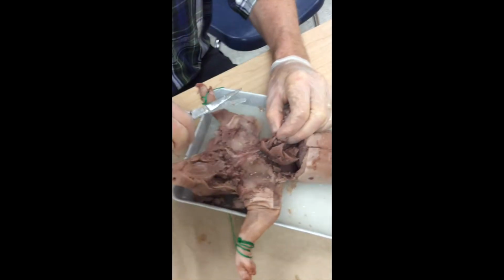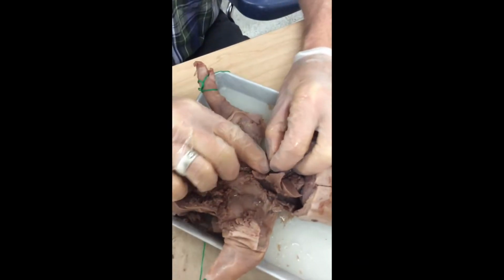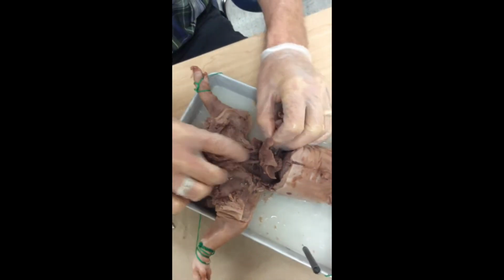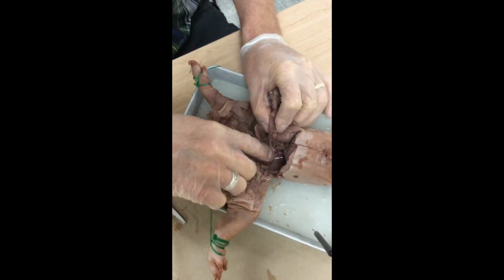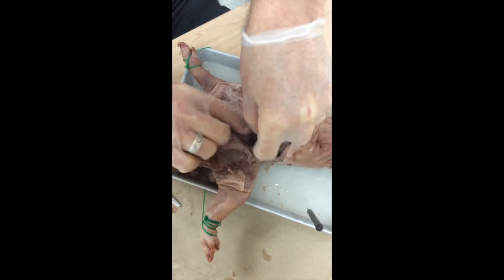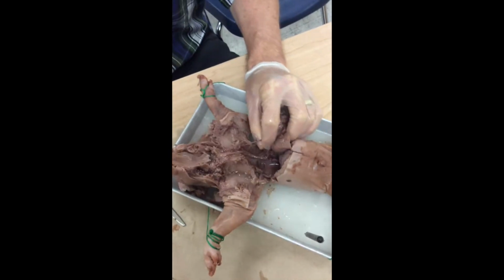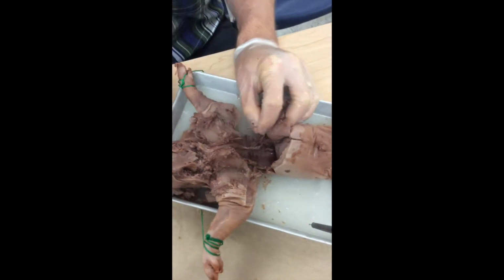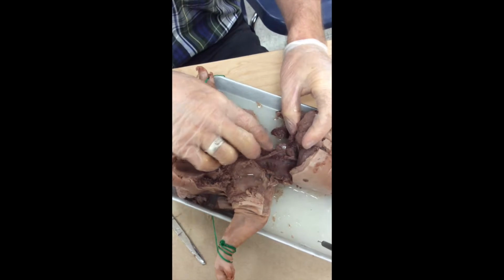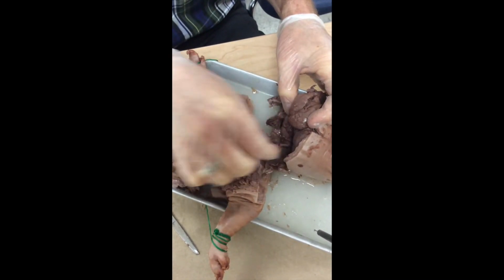I'm separating that esophagus as I continue to work down. Now, there is such a thing as a heart-lung transplant, so you can imagine a surgeon, wow, isn't that something? A surgeon would be involved with taking all this stuff out, just like you and I are right now. They, of course, would be a little more gentle, I suppose. It's not an easy surgery. Turns out I did accidentally cut the esophagus right there.